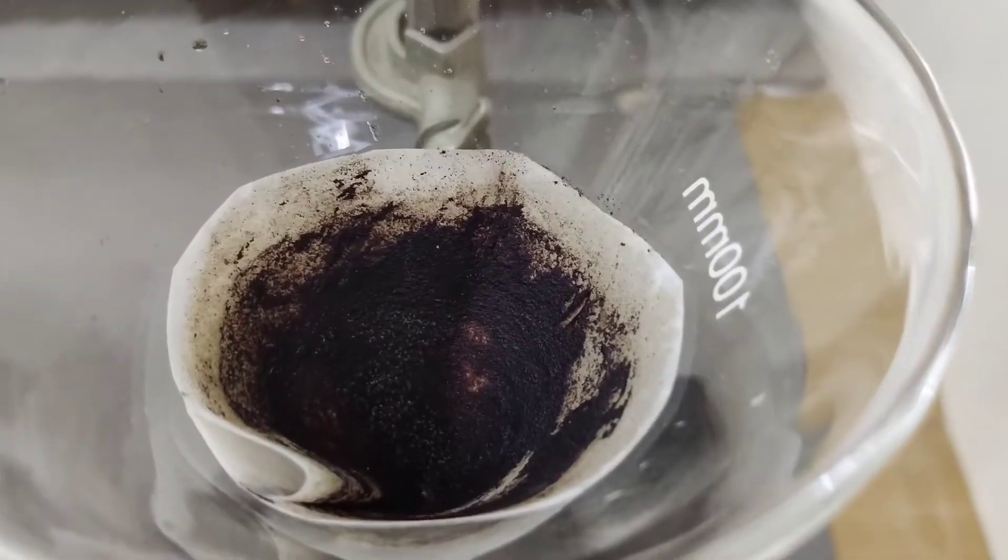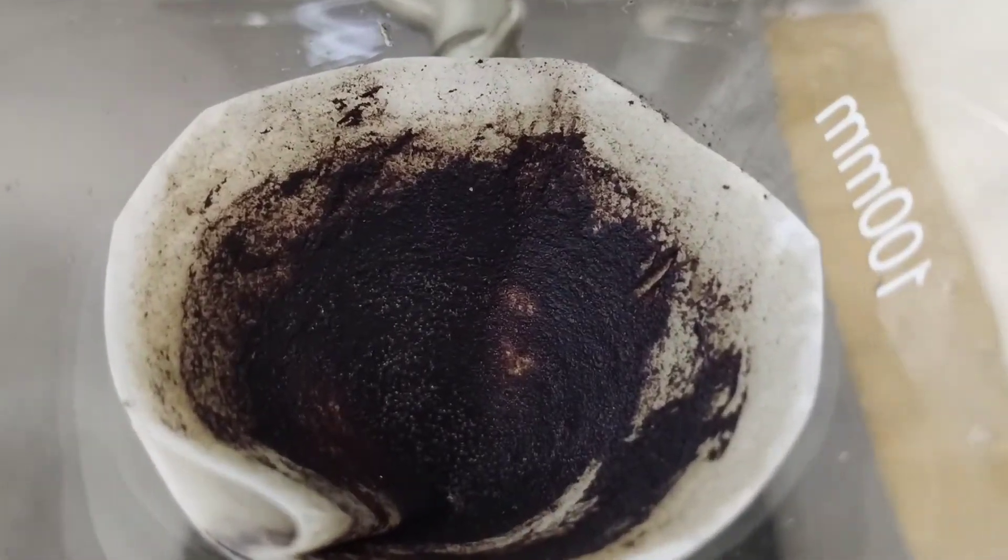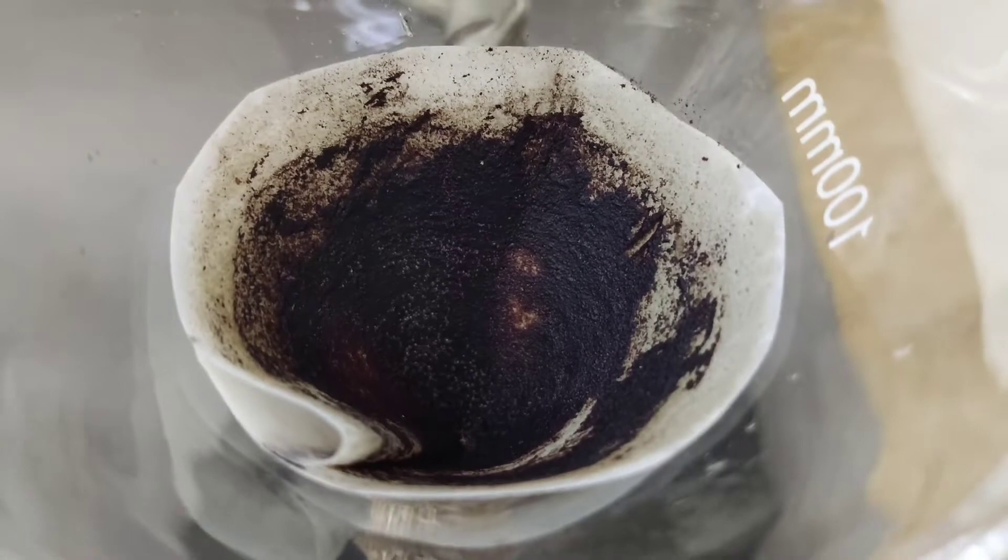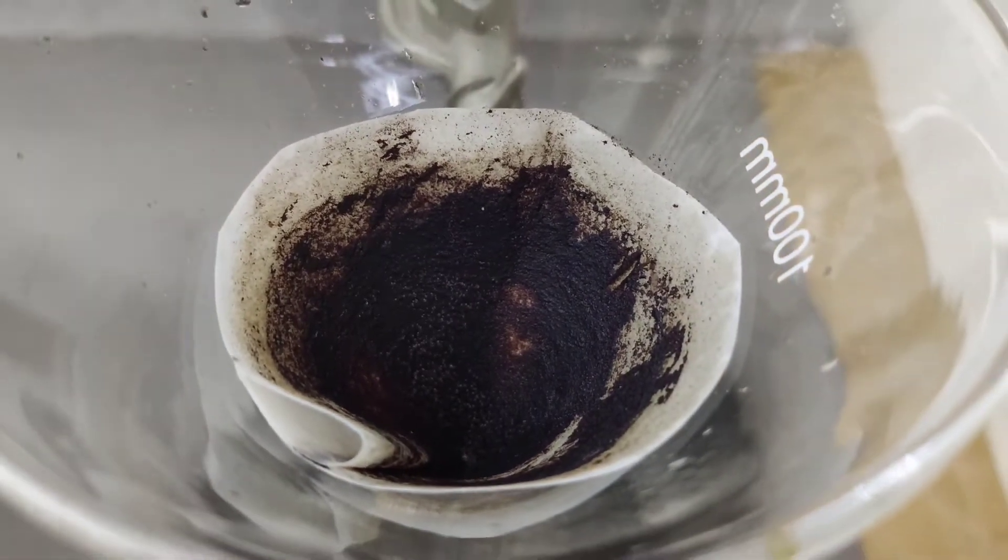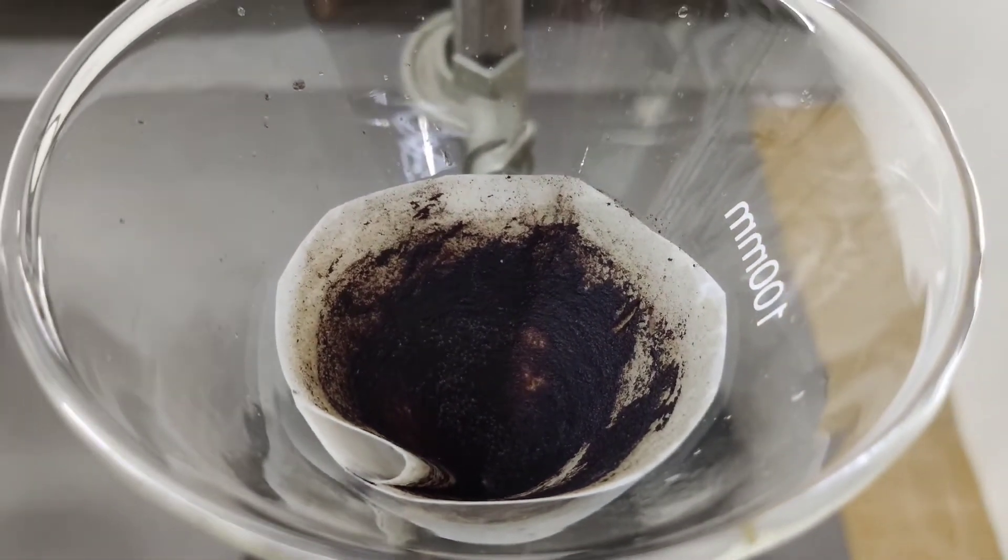Last time we made a cobalt-corrole complex with a dimethyl sulfoxide apical ligand that we precipitated in water and filtered.